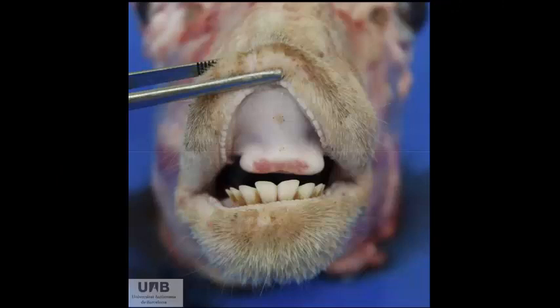Slide number 4 is tissue from a sheep. Can you give me a morphologic diagnosis and a cause? Okay, time's up. We're looking at the dental pad. There's a focally extensive area of ulceration on the dental pad, and this is pretty classic for the disease blue tongue. The morphologic diagnosis would be focally extensive necrosis of the dental pad. The cause is ovine orbivirus.